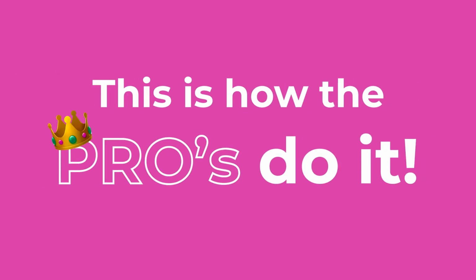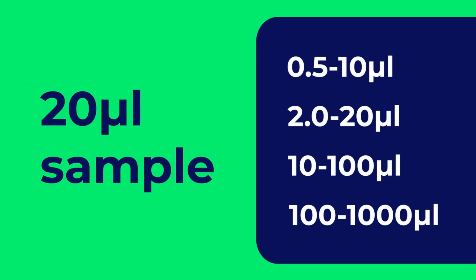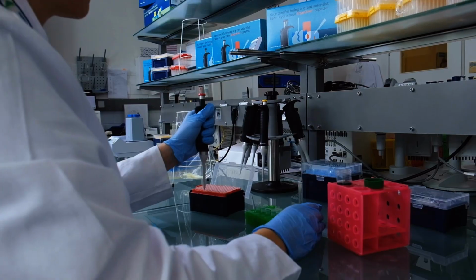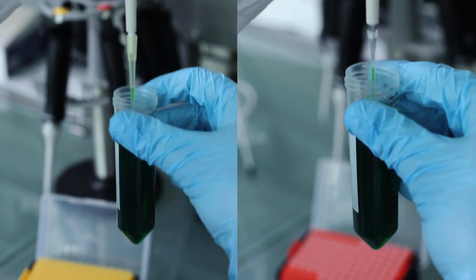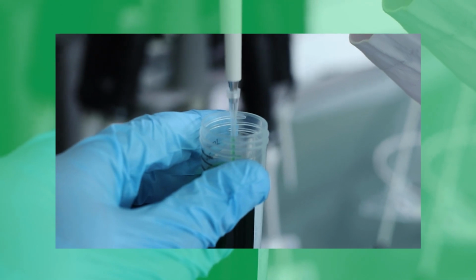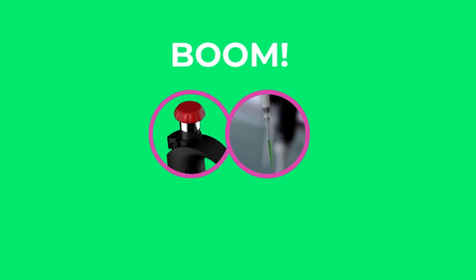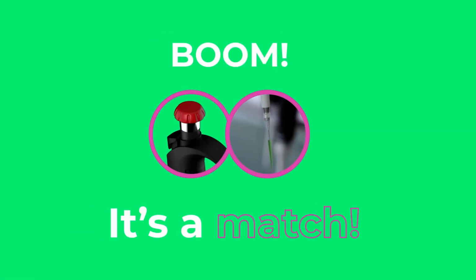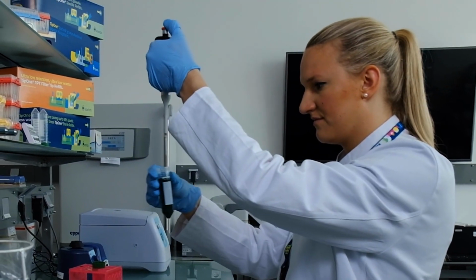This is how the pros do it. For the most accurate results, always try to use a pipette that has a maximum volume closest to the volume of the sample you're pipetting. When it comes to finding me my perfect match, aim for a tip that allows you to dispense your sample with as little dead air space as possible inside the pipette tip. So most importantly, remember to play Cupid and find me the perfect match. It's that easy. We're one step closer to becoming the dream team.